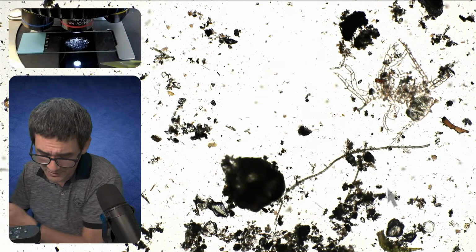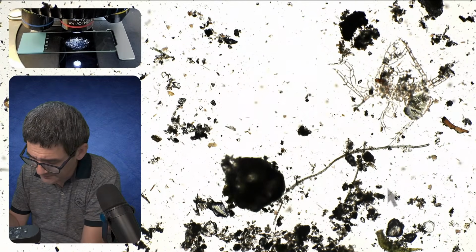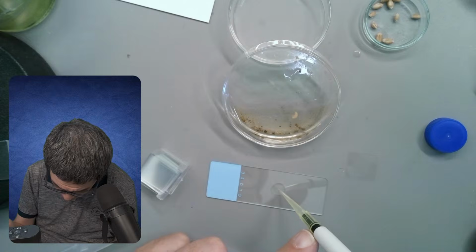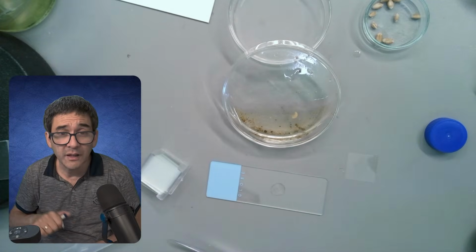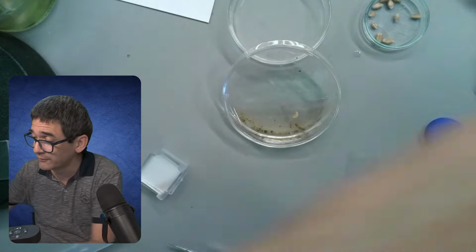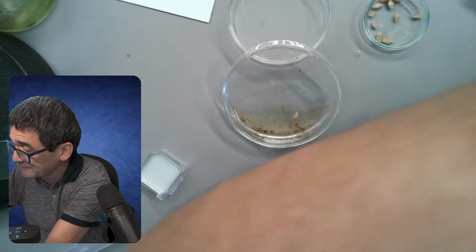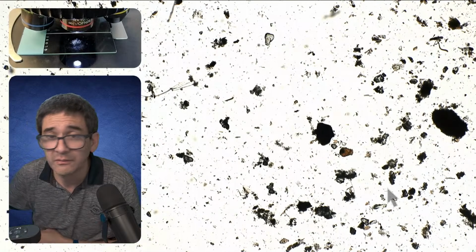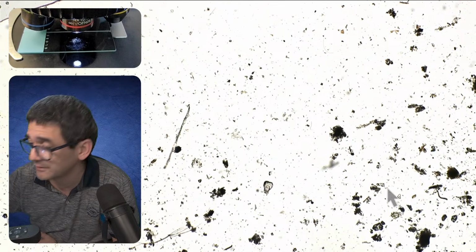I hope I was able to suck it up. I don't know. We're going to see if I actually managed to transfer it over here on this slide. If not, then also fine.